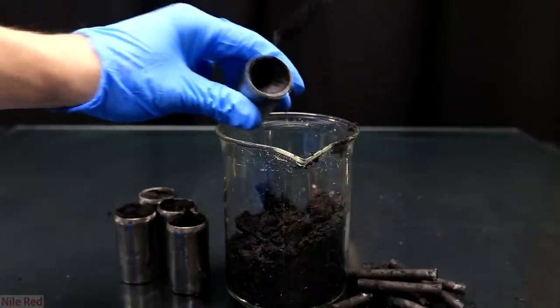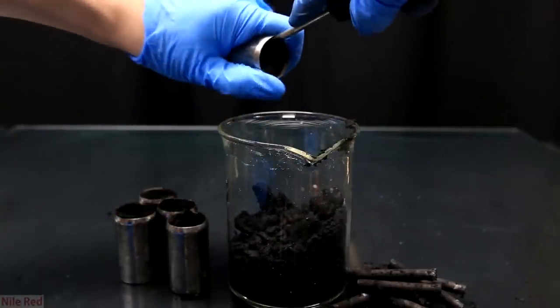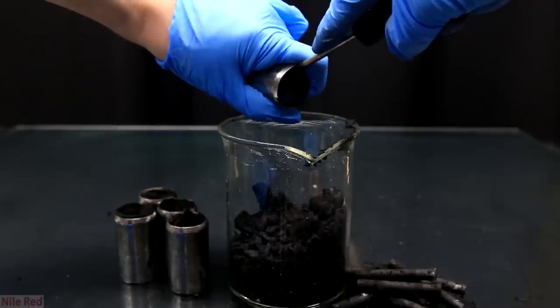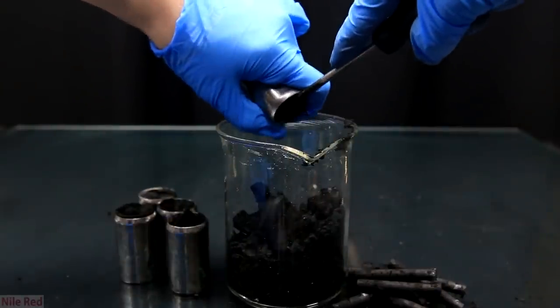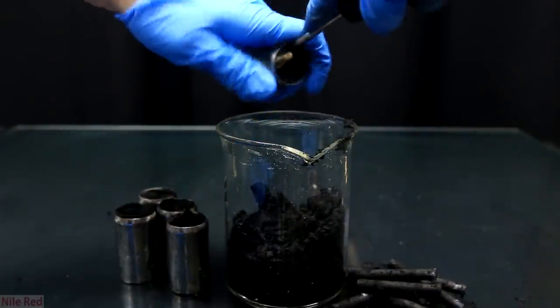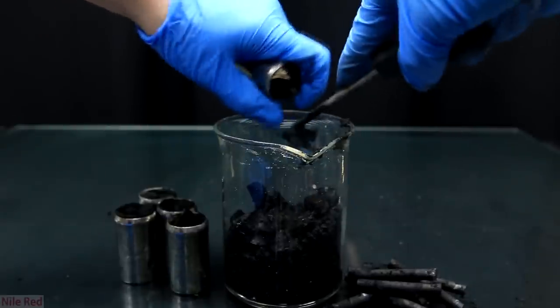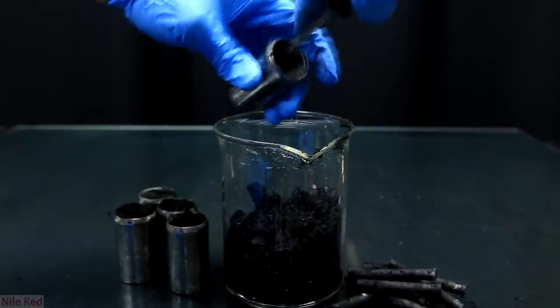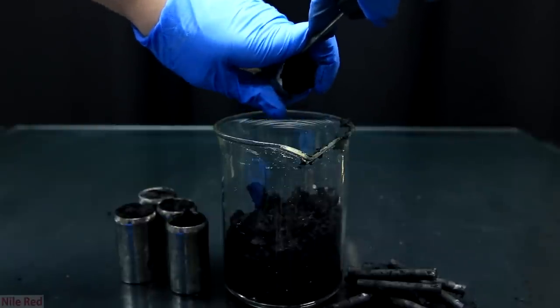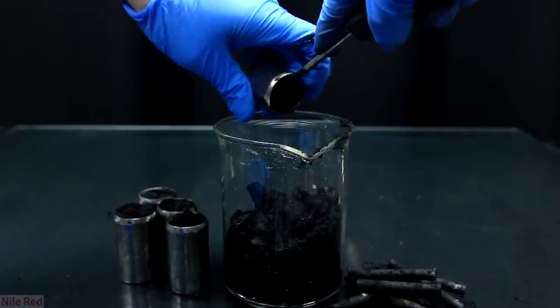So you can see in this shot I'm not digging and I jammed the screwdriver in the bottom and then I can pull out a lot of manganese dioxide at once. I only need to do this two or three times until almost all of the manganese dioxide was removed. Doing it this way also damaged the paper less and therefore there was less paper contamination.